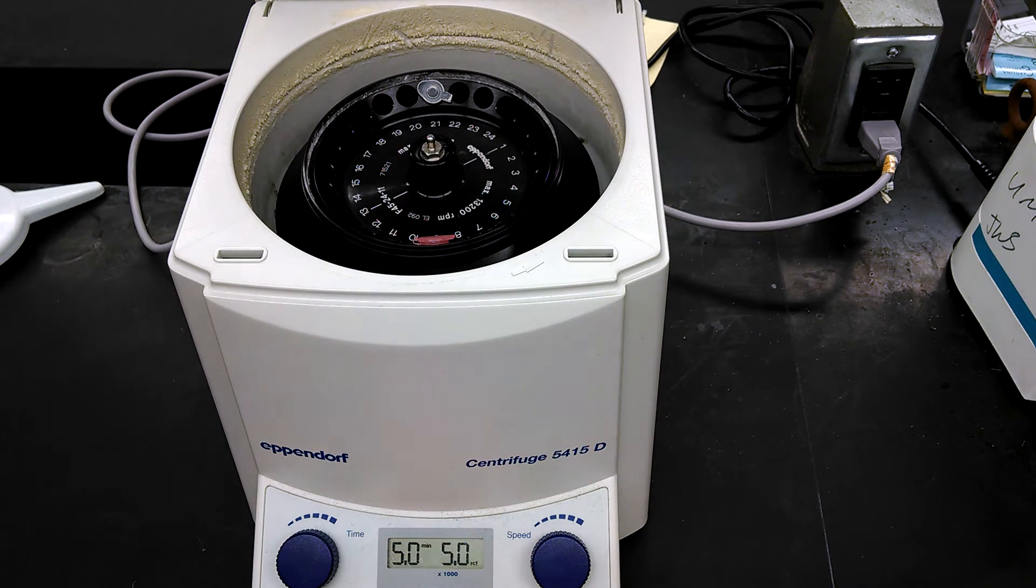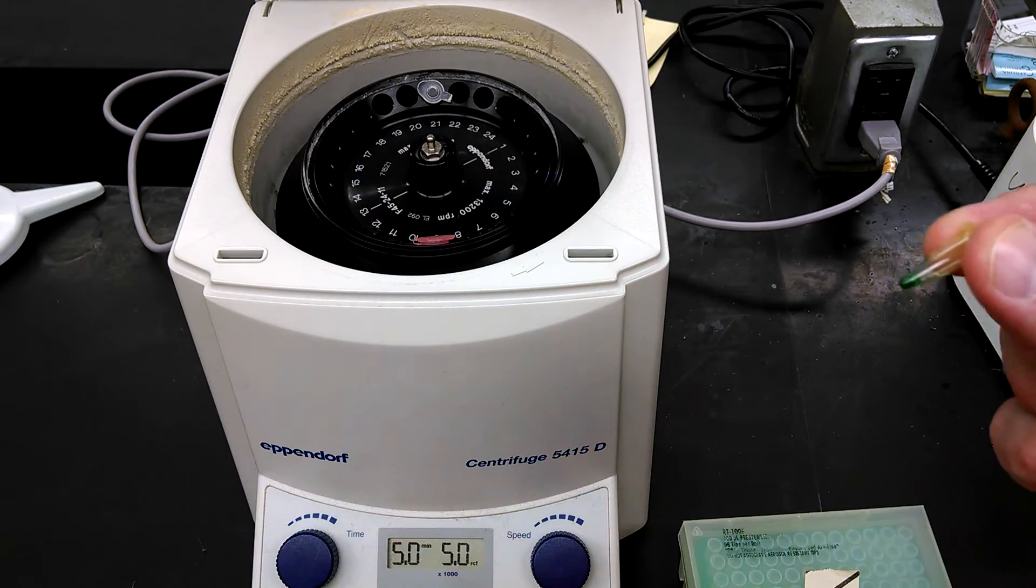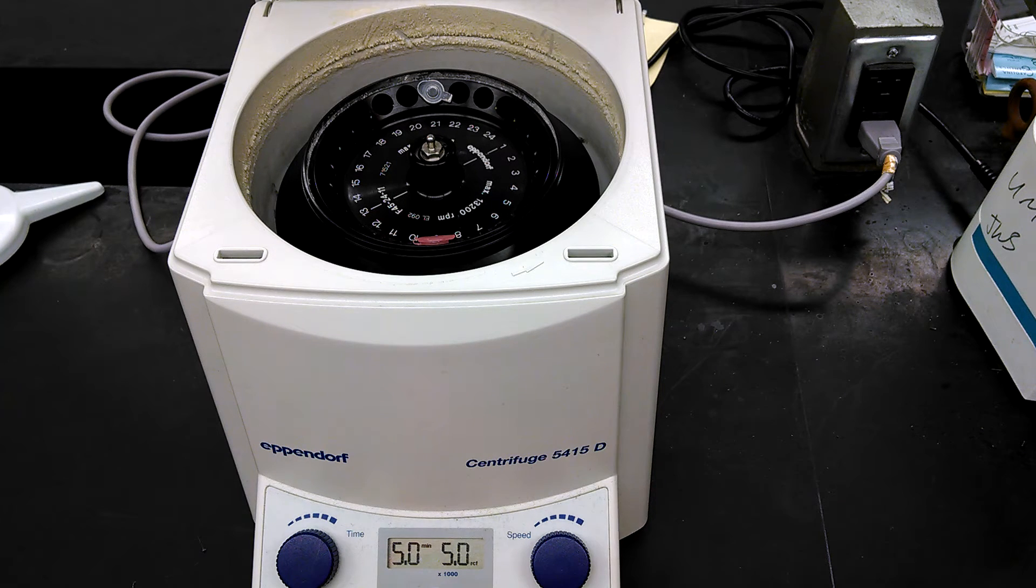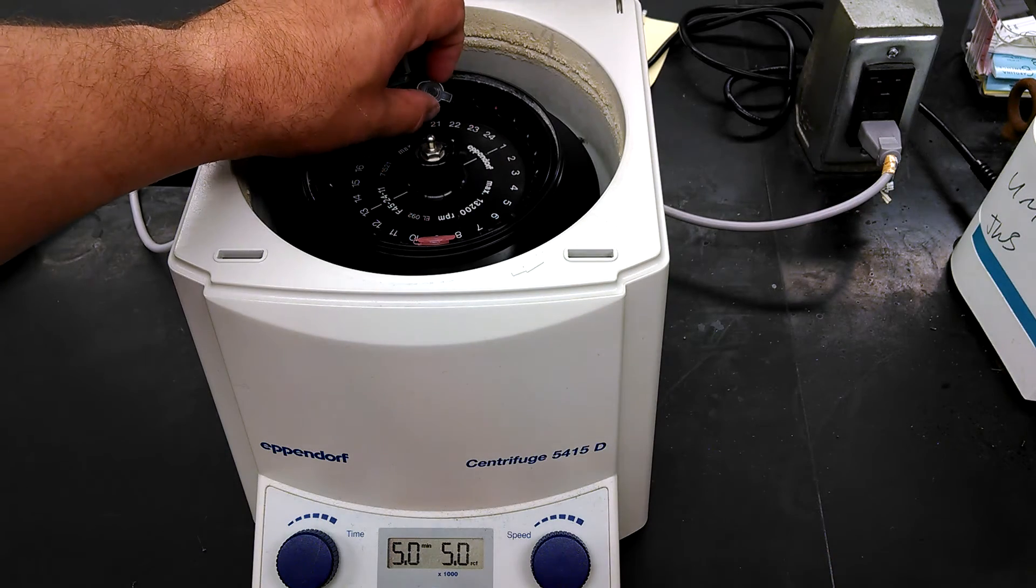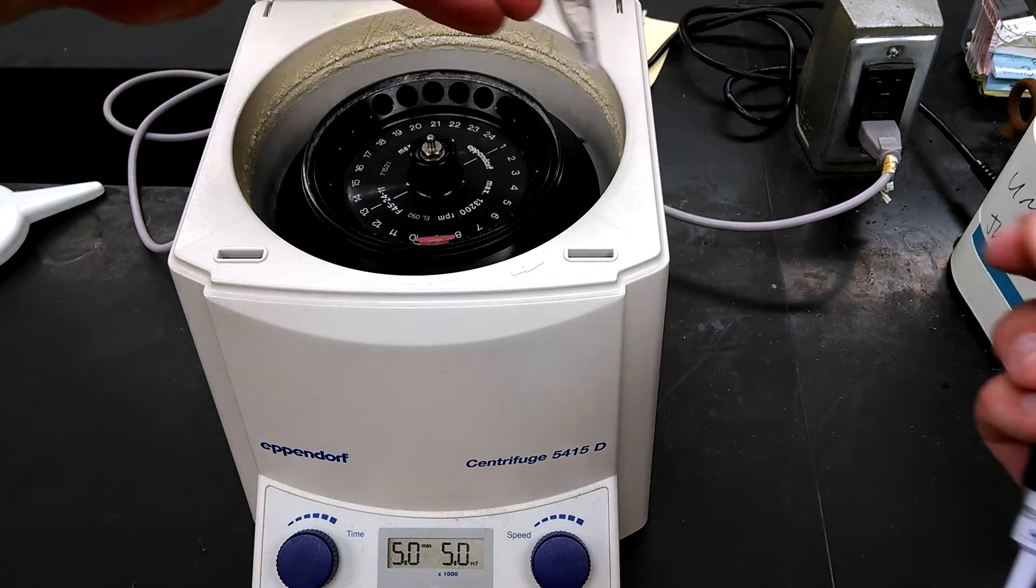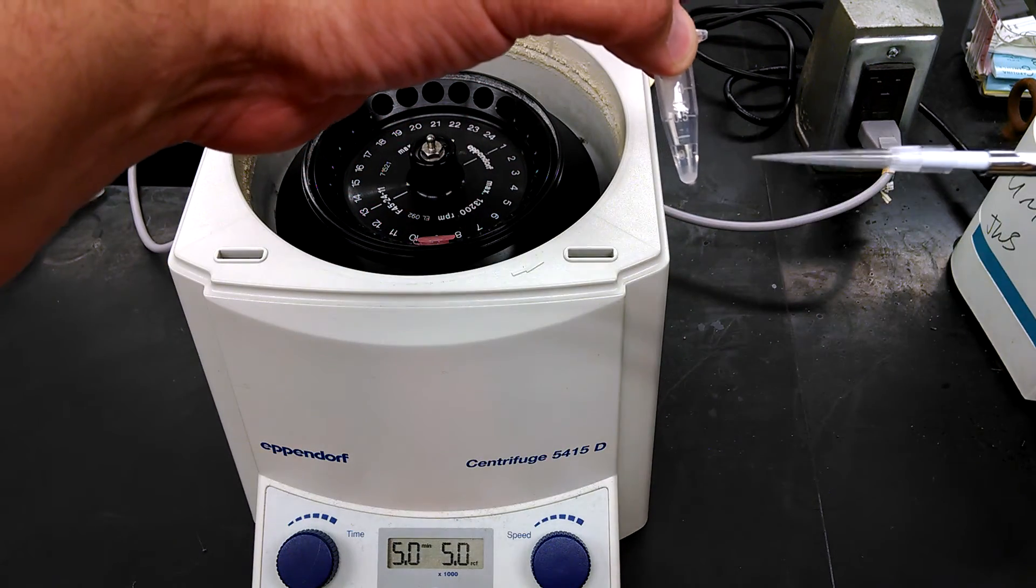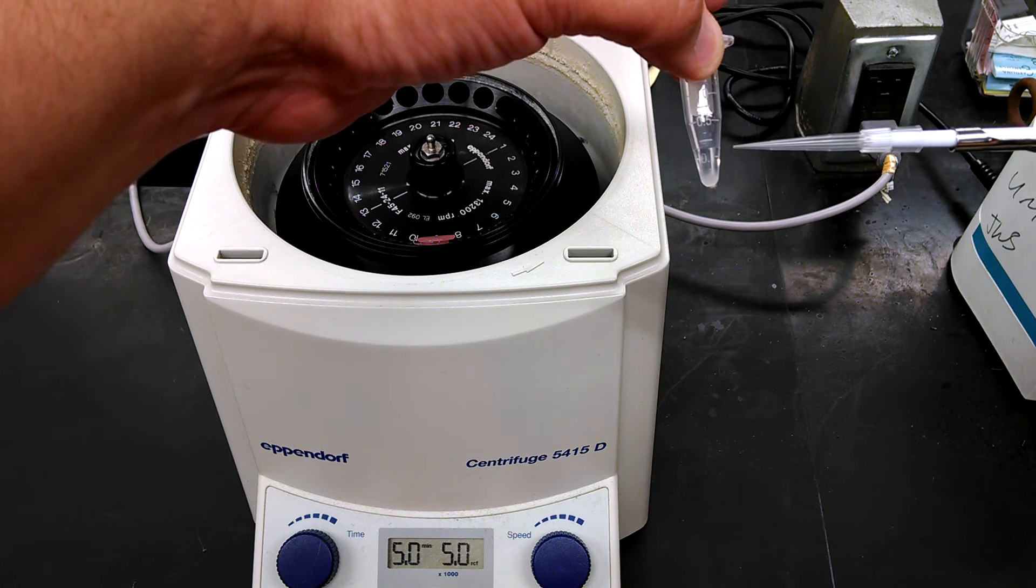We don't want that. So what you do is leave your sample in the centrifuge, get a pipette, get your PCR tube, and get all ready to go. So what we want to do here is we want to transfer exactly 23 microliters right from our sample, and we're going to move it very gently. And I don't know if you can see it, but you can just see that right here, down here are the beads, and up here is clear liquid.